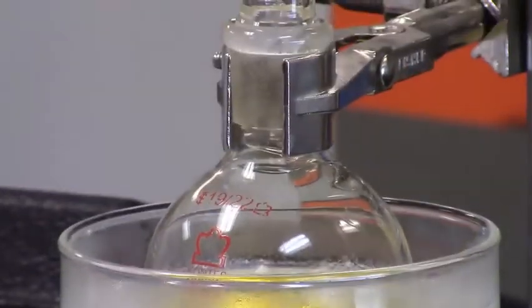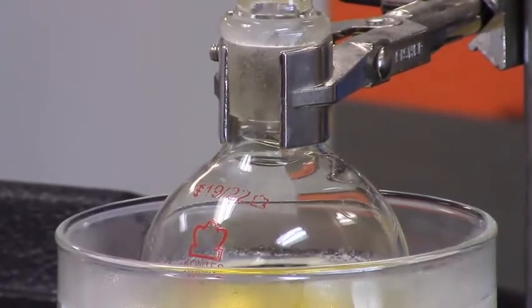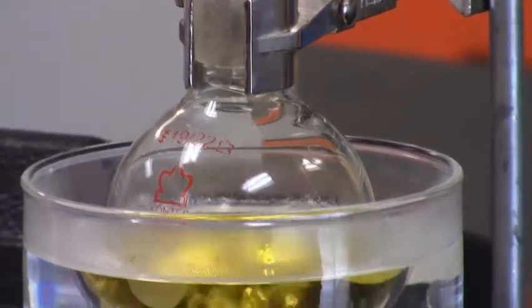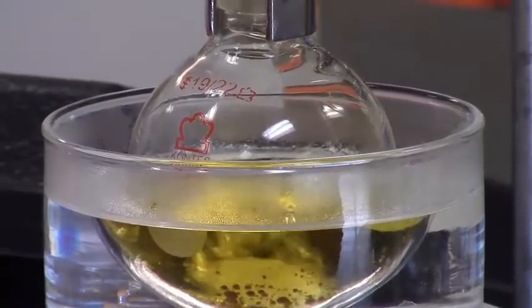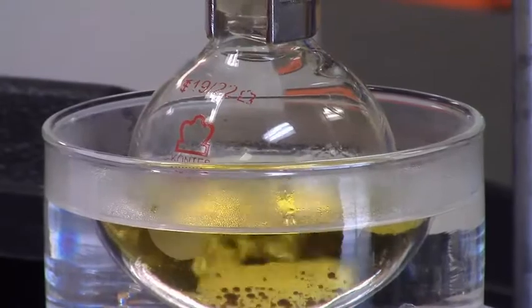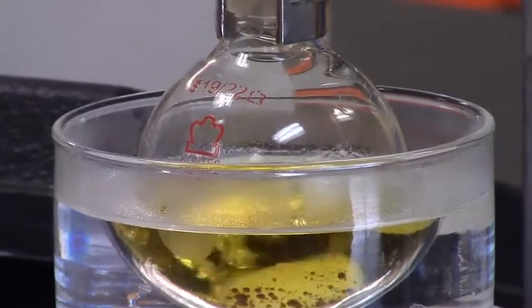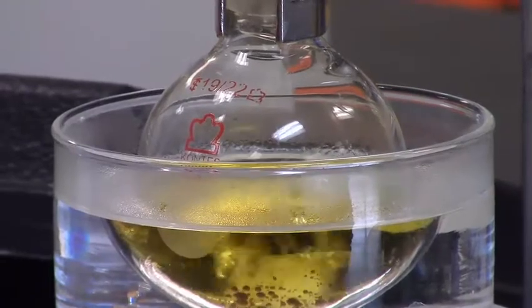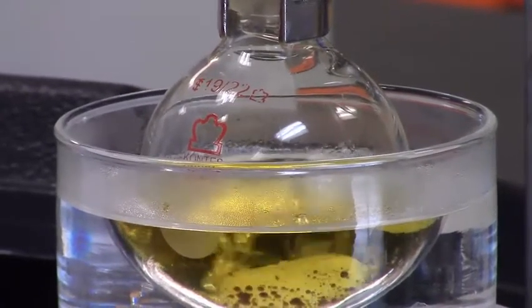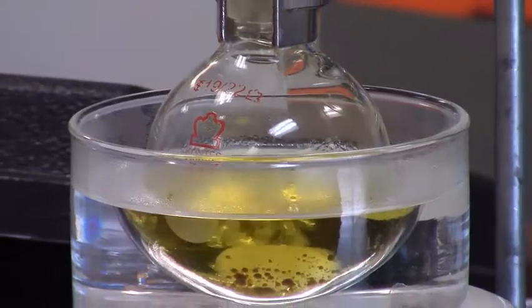Common question in organic chemistry is, do I need a boiling chip? Well, a boiling chip is always a good idea if you're boiling a liquid. However, we have a stir bar here, and that replaces the utility of boiling chips. So, as long as you have a stir bar, a boiling chip isn't required. It provides an area for the bubbles to nucleate on, and with gentle stirring, that's sufficient.